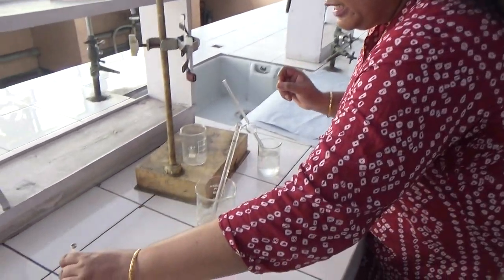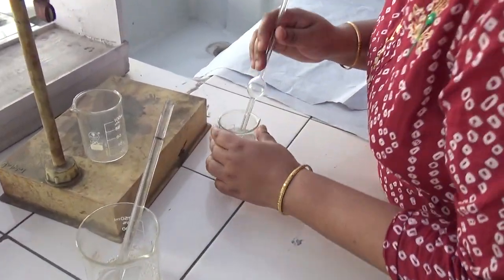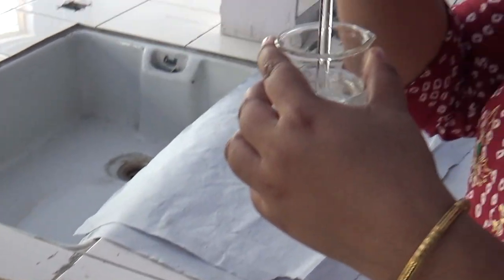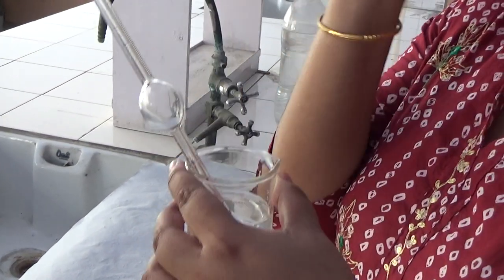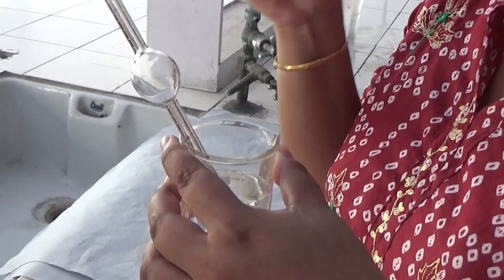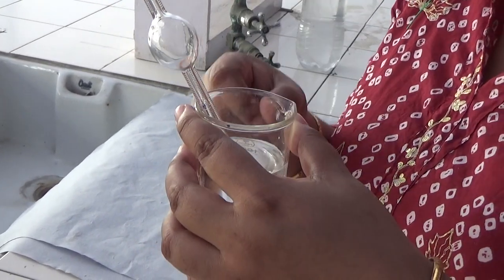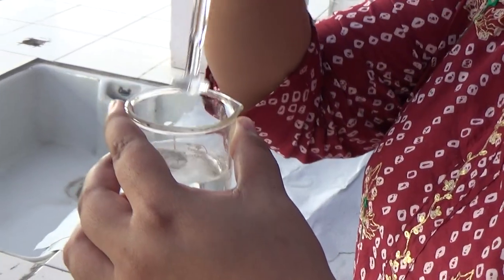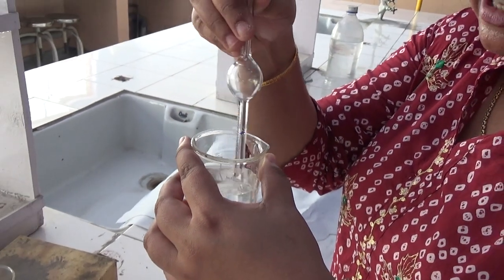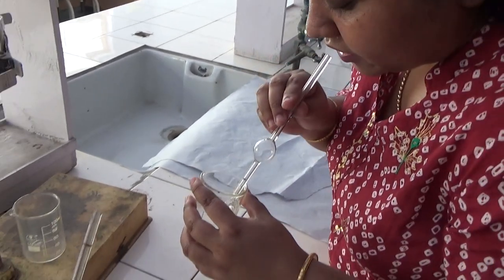Now, we will start the surface tension. So first, we have to suck the water. Here, three concentrations I have said. The first concentration will be zero — zero percentage. Zero percentage means this water. So, we will be finding out the surface tension; we will be taking the drops of water first.